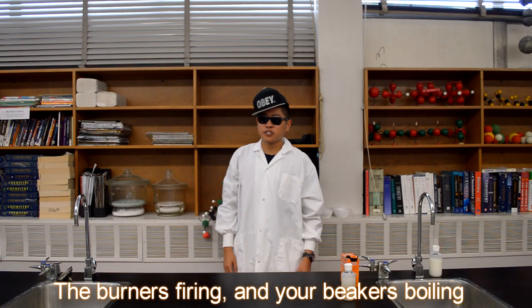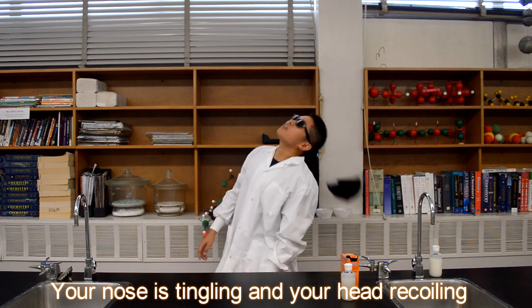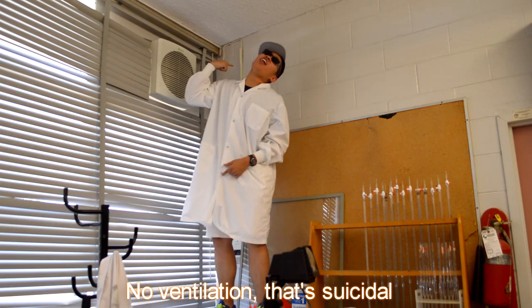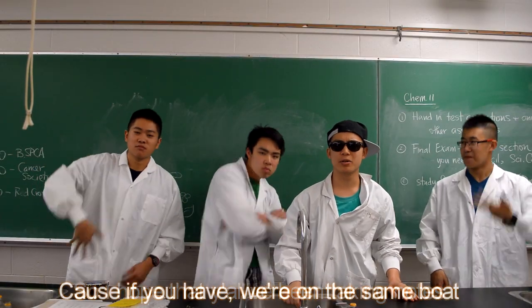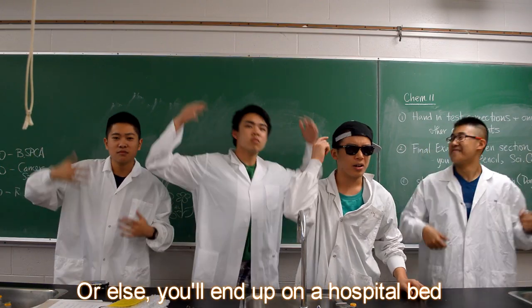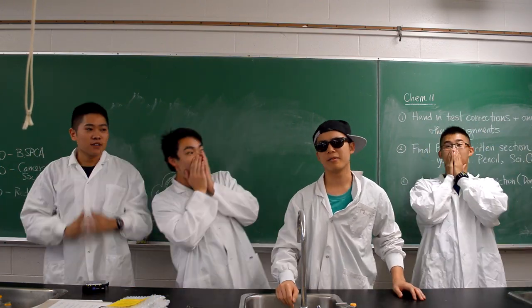Burner's firing and your beaker's boiling. Your nose is tingling and your head recoiling. Fumes around, they linger idle. No ventilation, that's suicidal. So I hope that y'all been taking notes, 'cause if you have, we're on the same boat. But in the end, just use your head, or else you'll end up on a hospital bed. Yeah!